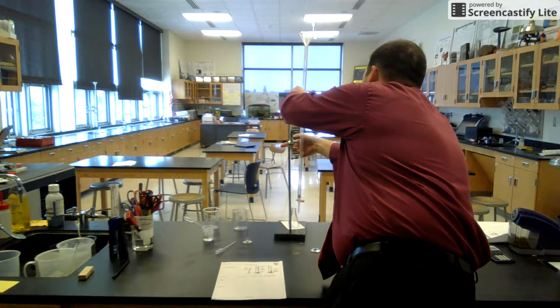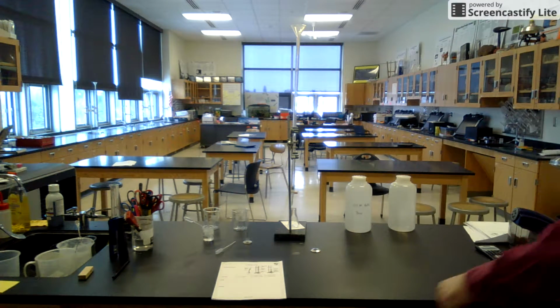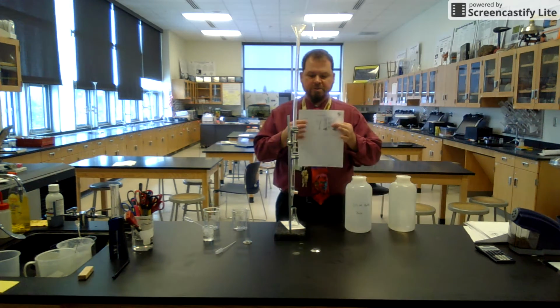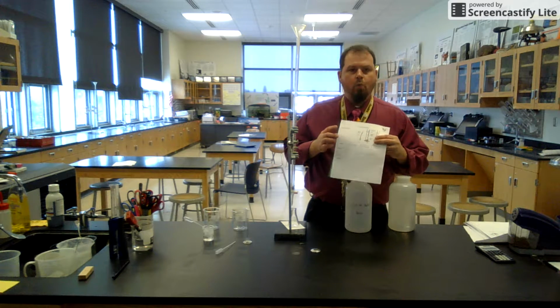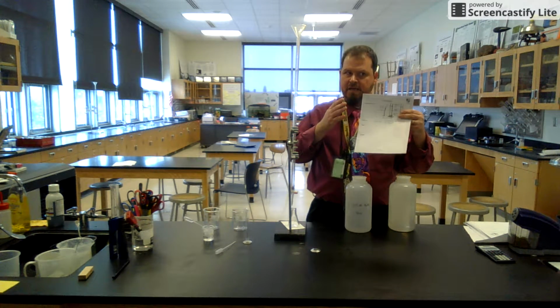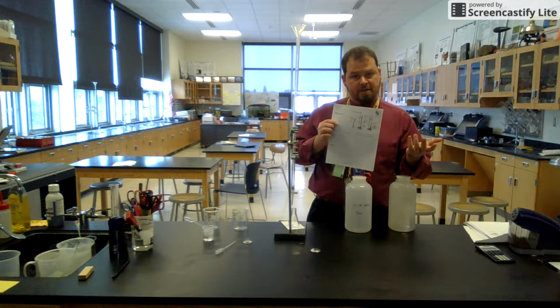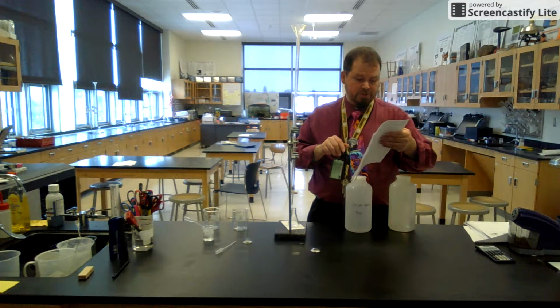Real quick. There's a few things we need to know and be able to do. So first of all, background. The background information has to have something about a neutralization reaction. What do I produce when I do a neutralization reaction? What is the pH of the product when I do a neutralization reaction? And something about indicators. Indicators do what? So those are all the background. You answer all those questions.